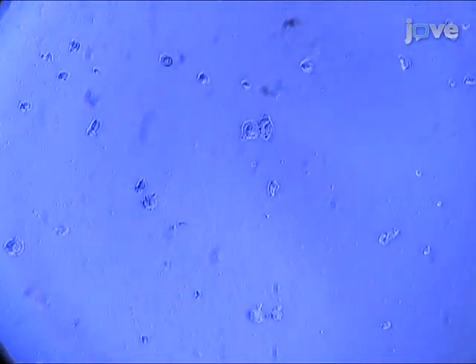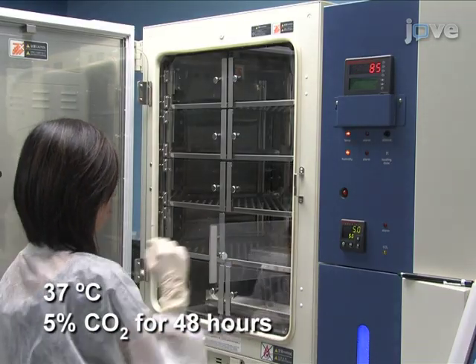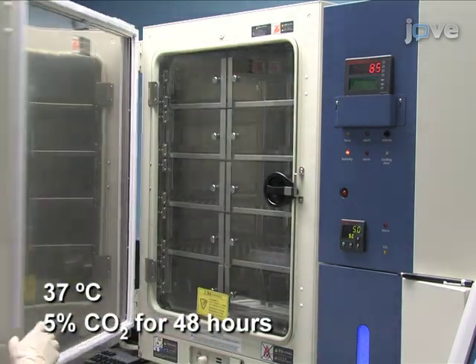Rock the plate back and forth gently and observe cultures under a light microscope to make sure cell clumps are evenly distributed throughout the wells. Place the plate in an incubator at 37 degrees and 5% carbon dioxide for 48 hours to ensure cells are attached, flat and large enough to easily visualize.